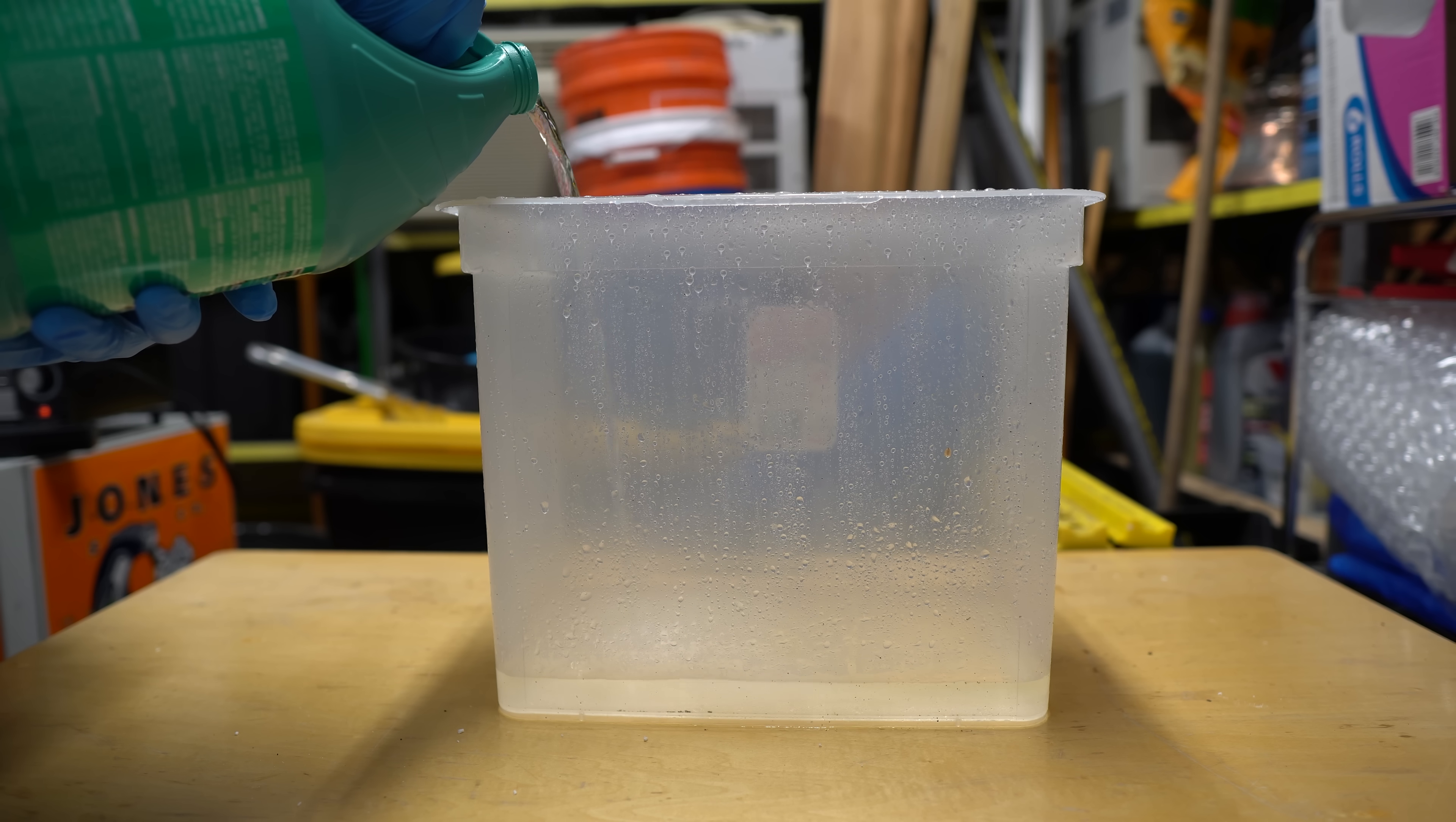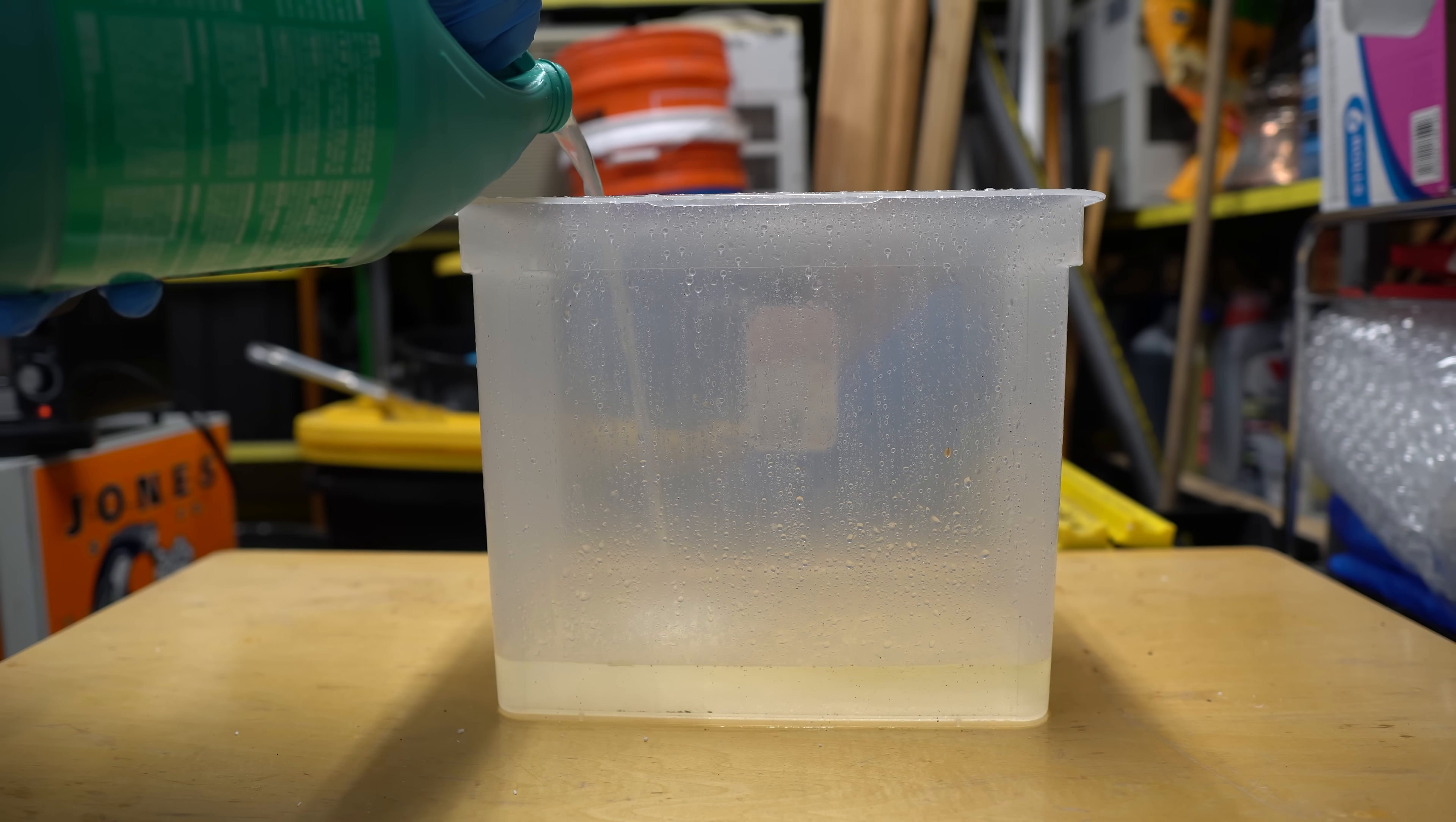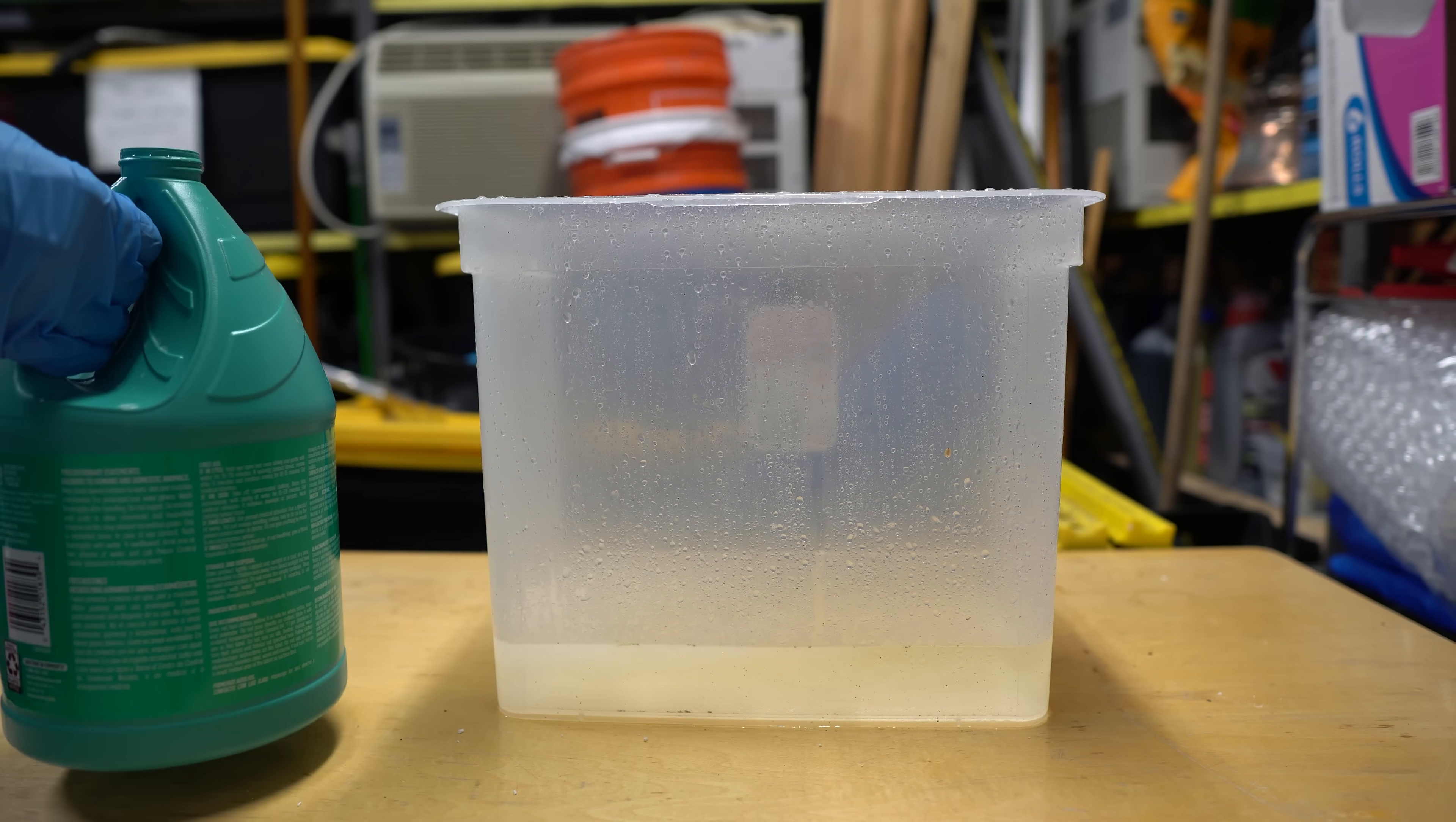Chloroform is a lot denser than water, so it's going to sit on the bottom of the bottle. You're going to decant most of the upper layer, but make sure you do not dump it all into your waste container. As I was dumping this out, I got this incredibly weird smell, and I started to freak out.